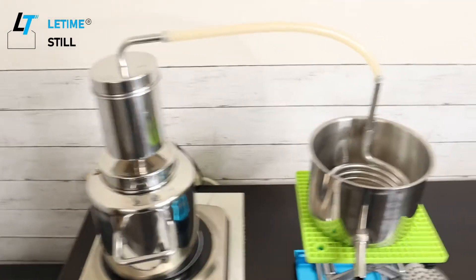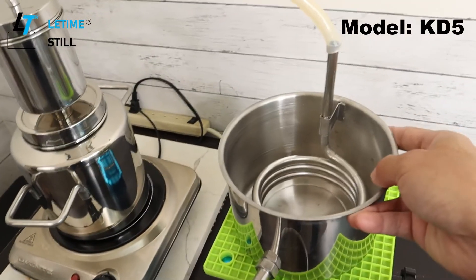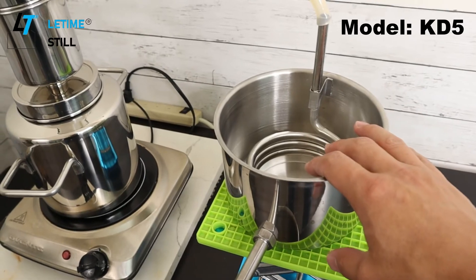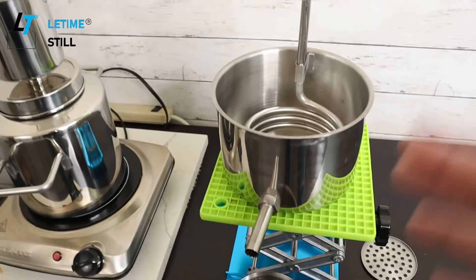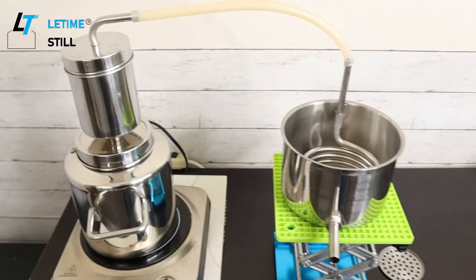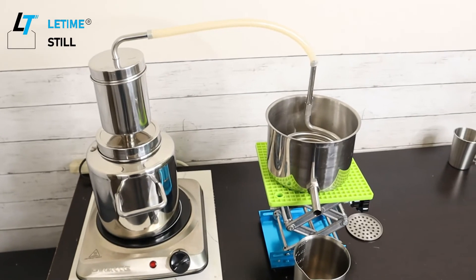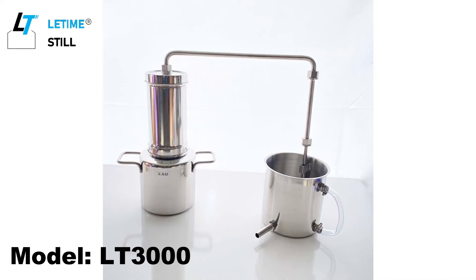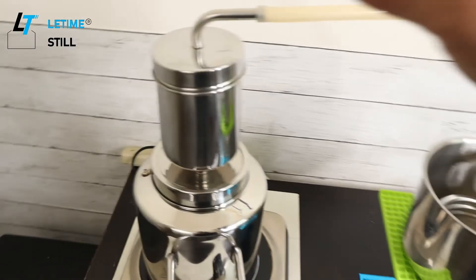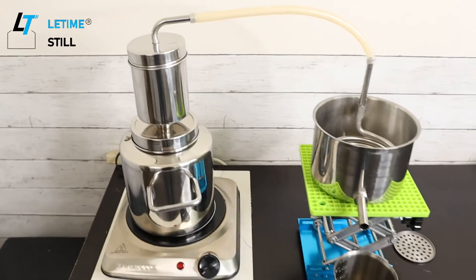You can also do hydrodistillation if you mix some material with the water, but I normally recommend steam distillation because it is easier to control. This is the condenser — you can add an ice cube in it to do the condensation and then collect the distillate. It takes less space compared with the LT3000, which is a larger version of the home distiller. I will show you step by step how to do the steam distillation with the KD5.